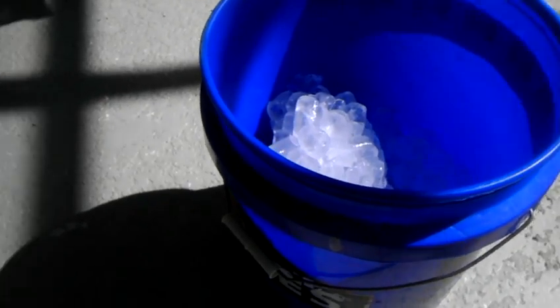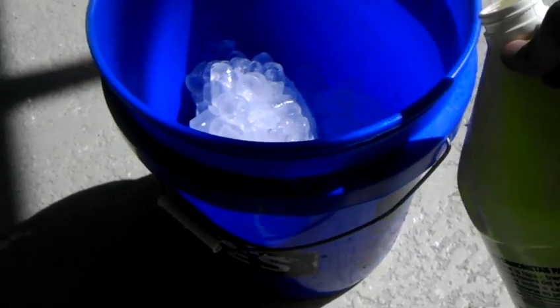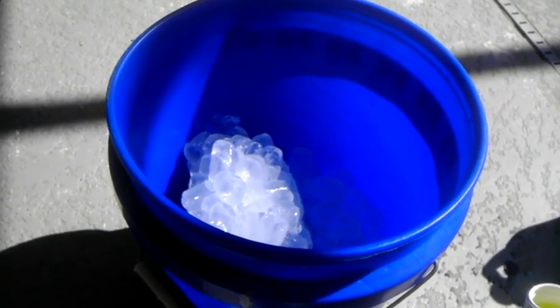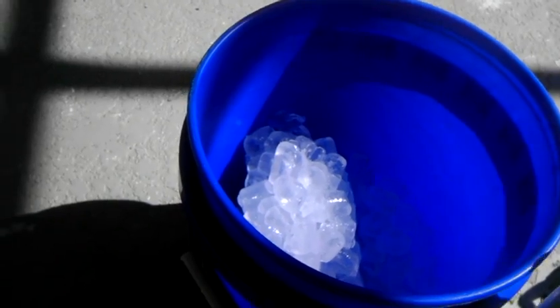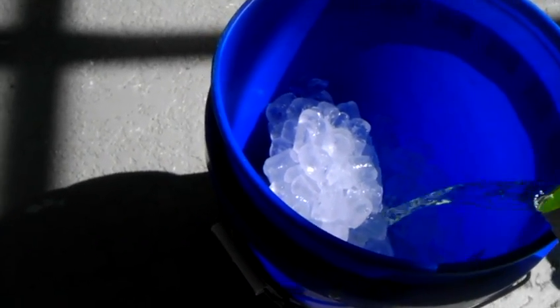One of the most important things is to keep this reaction cool. I've got 5 pounds of ice, and you want to keep it cool because this reaction gets hot — it's exothermic — and the chloroform will just boil off because of the heat. You have to keep it cool or else you're just going to boil away all your chloroform out into the atmosphere.